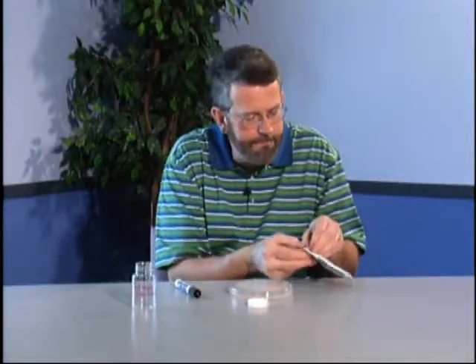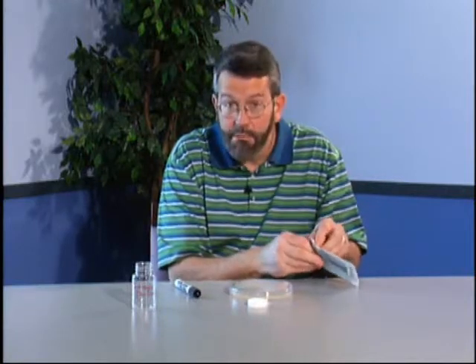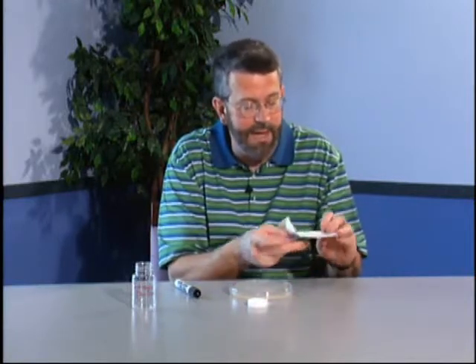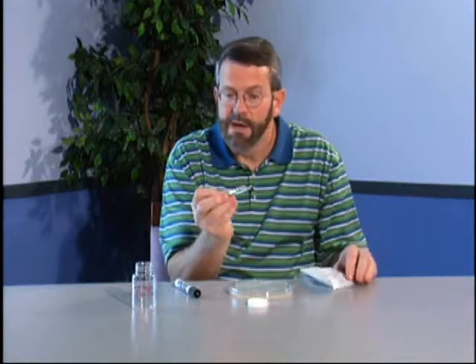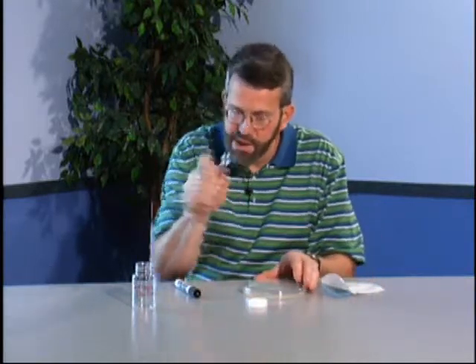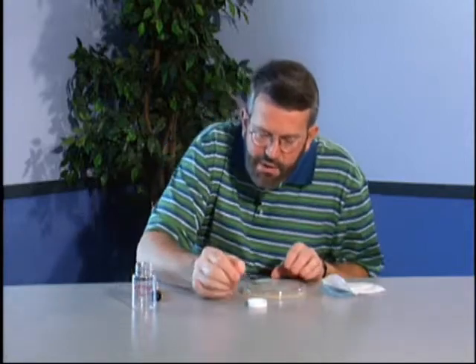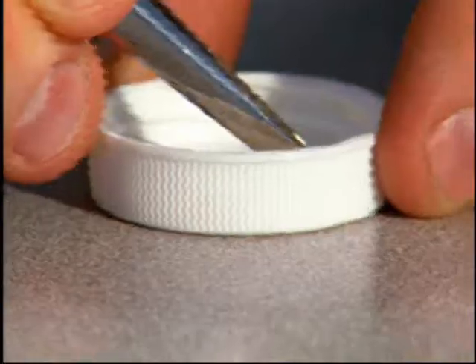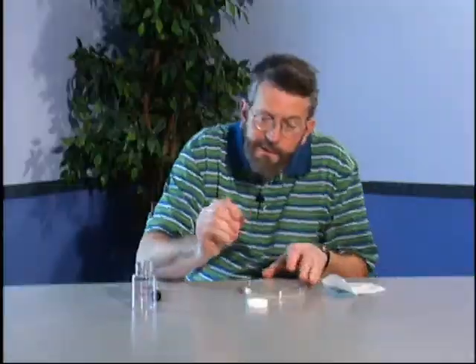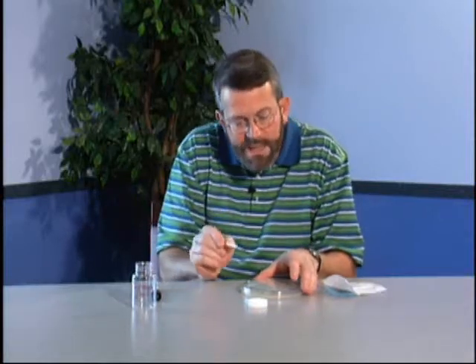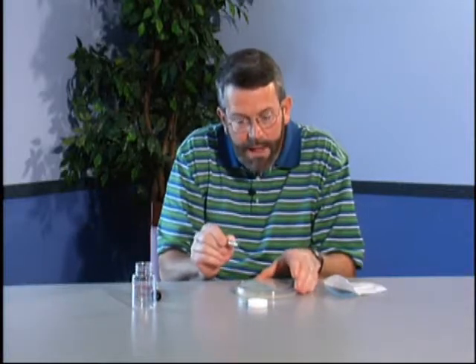Now we're going to open this up. This is sterile. It doesn't have any bacteria growing in it at all. There it is right there. I'm not going to touch the surface. I'm going to take a little chunk of this bacteria-laden dookie. Give me a little chunk. And I'm going to open this up and I'll make a smear. Okay? You ready? All right.